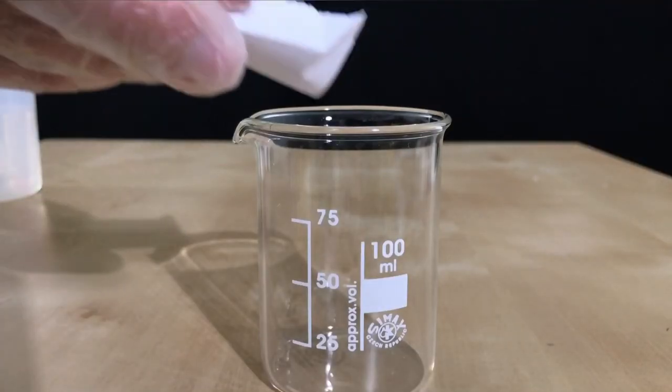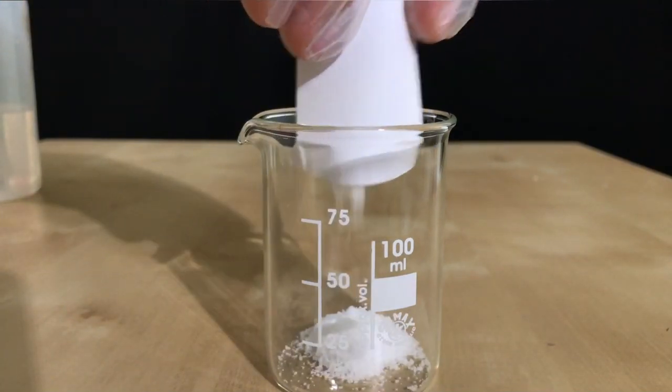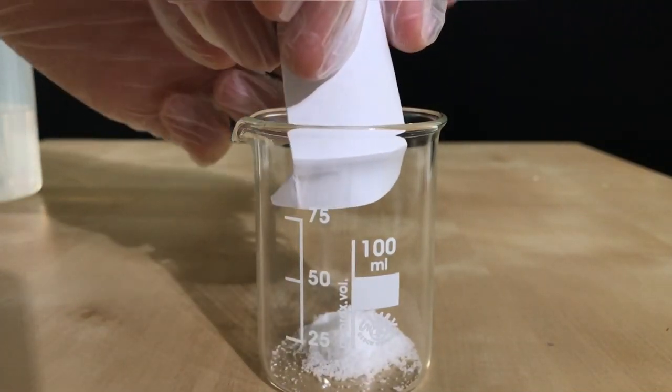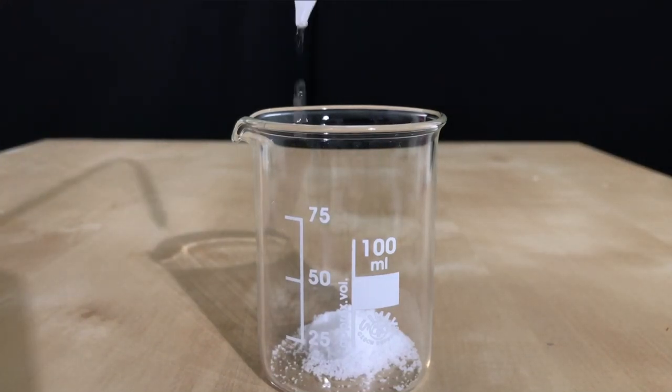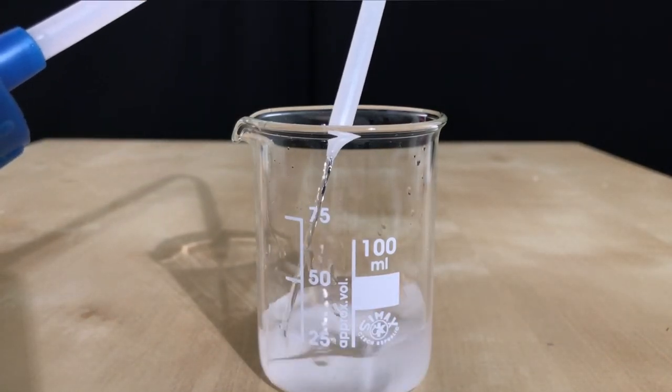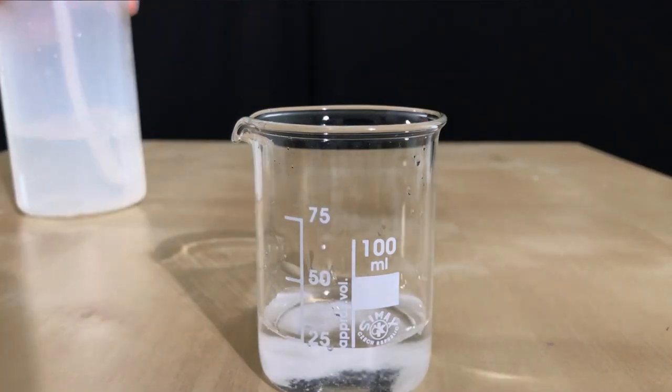The flask was swirled a few times but mercuric chloride dissolves really slowly. With potassium iodide it's a different story, you add it to a beaker and then you add some distilled water. Potassium iodide, after swirling the beaker only a few times, dissolves almost instantly.